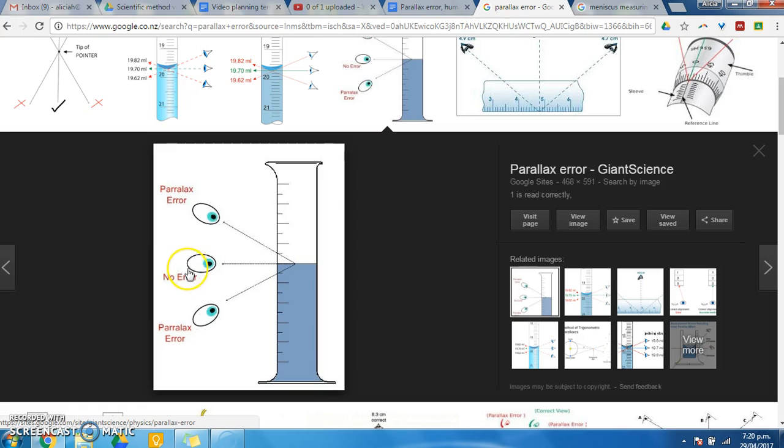If you crouched down or held the measuring cylinder up or supported it so that it was at your eye level height, you'd be looking straight on to the measurement, and that would give you no error and the accurate reading. So parallax error means to look from above or from below at something, and we don't want to do that. We want to look from eye level.